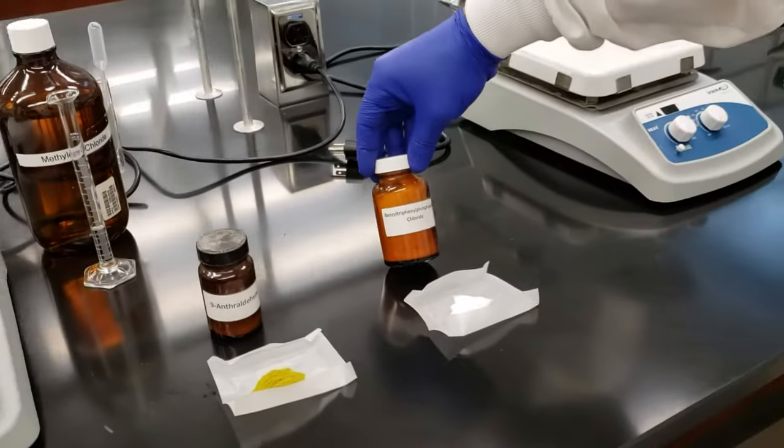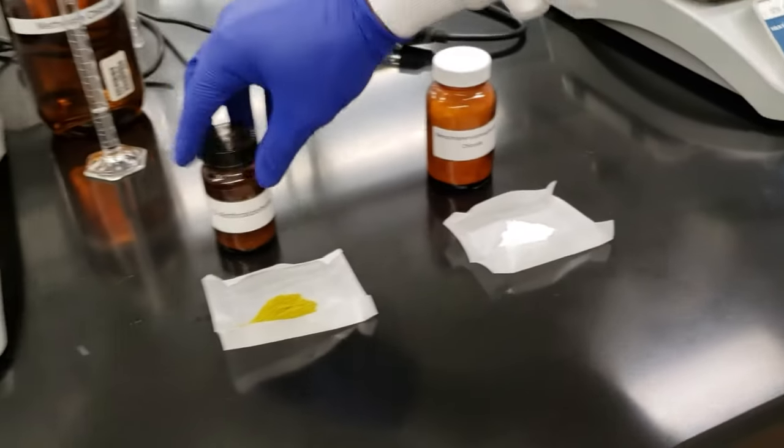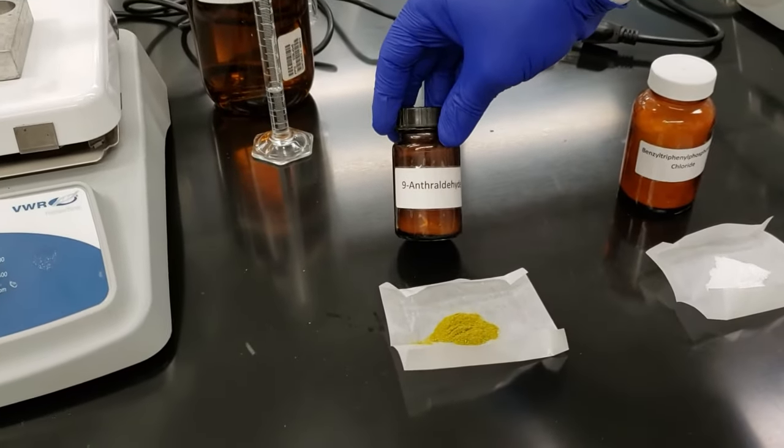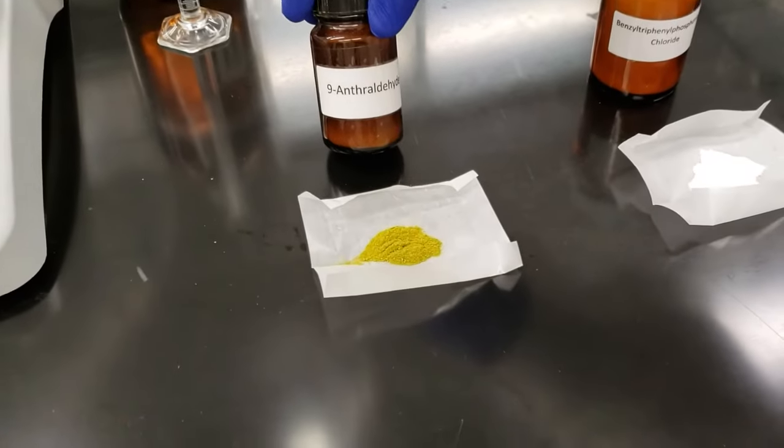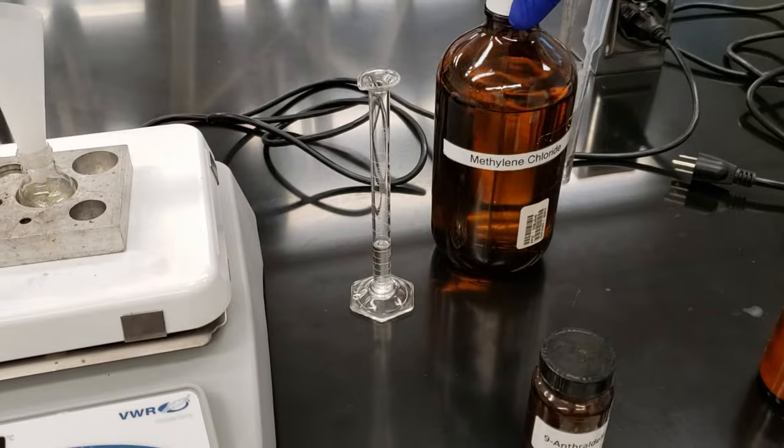We've got our benzyltriphenylphosphonium chloride, we have our 9-anthraldehyde, and our methylene chloride is our solvent system here.